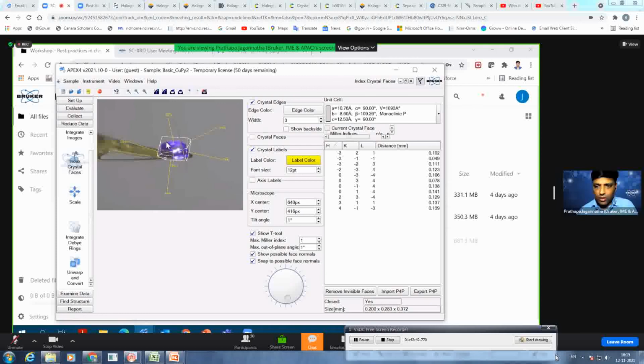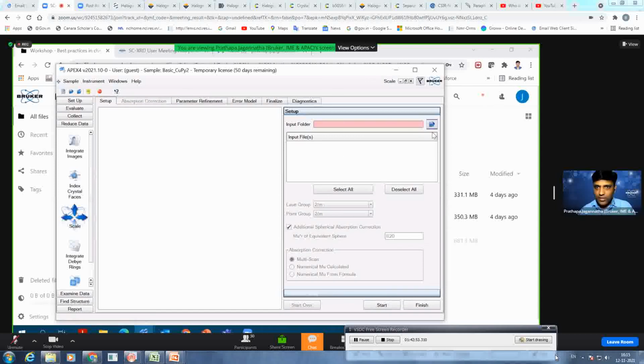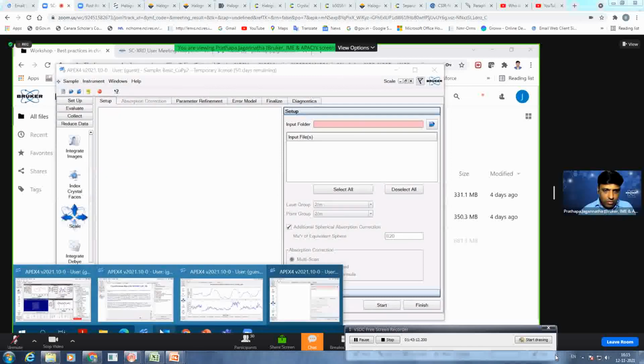Okay, so this is not a perfect one, but if you have indexed crystal faces, then ideally you can click on the scale. Probably you need to reintegrate. I do not have information here, so this will be written to your P4P file. Unfortunately, I do not have full data to show here. Carsten, do you have something readily available? I guess I also included a video on the citric acid, so maybe you can, is it? Okay. I hope so.